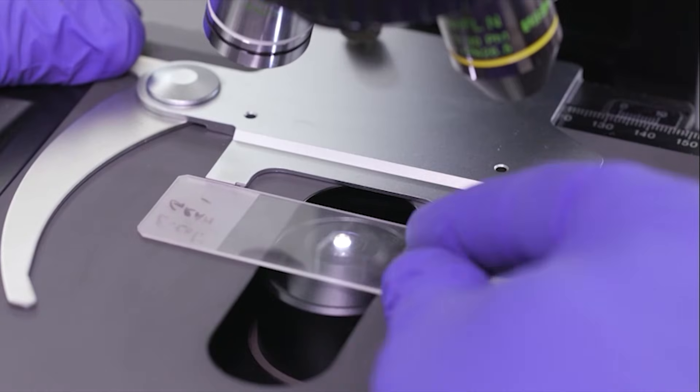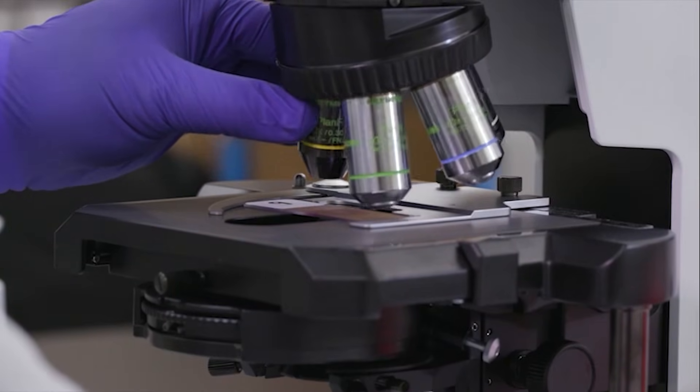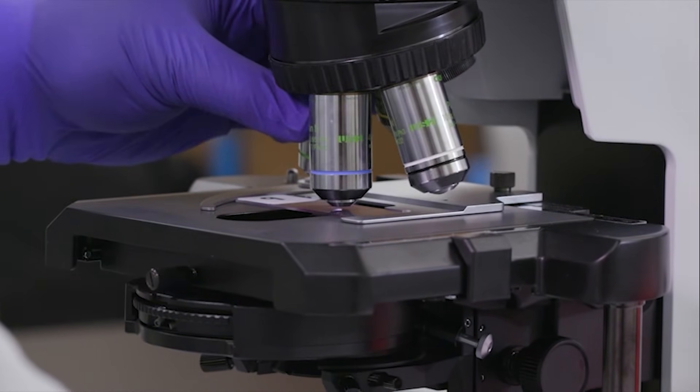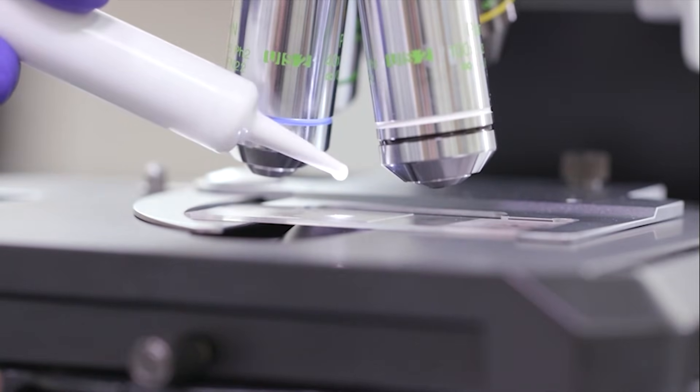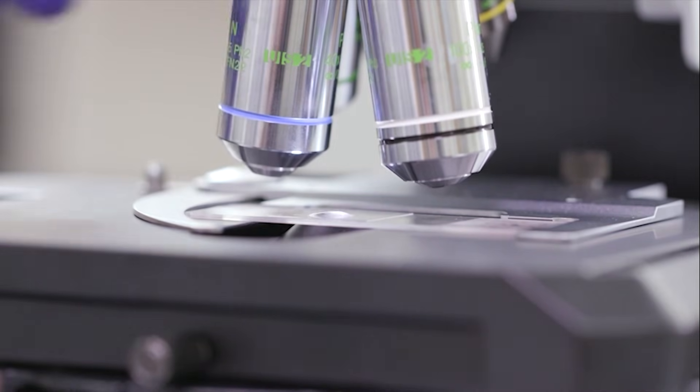First, locate the cells under the 40x objective. Then add a drop of immersion oil to the center of the smear and view under the 100x oil objective.